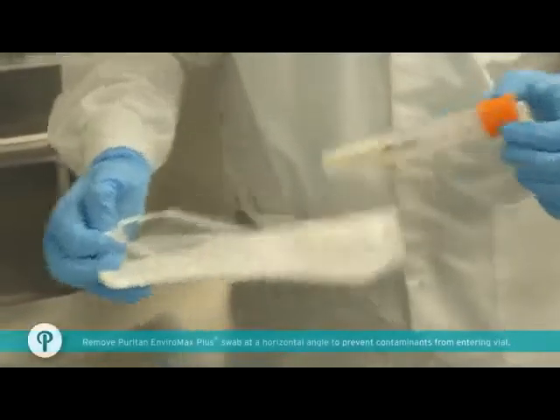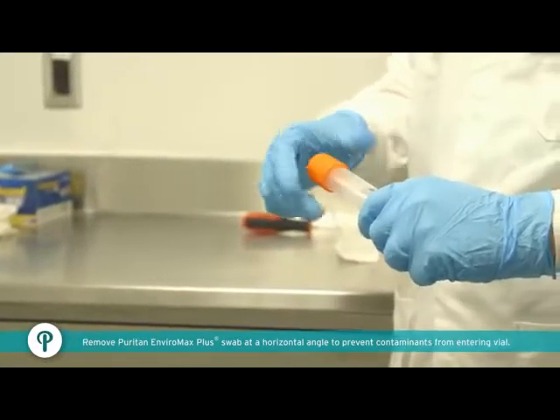Remove Puritan Enviromax Plus swab from vial by holding the cap and twisting counterclockwise.